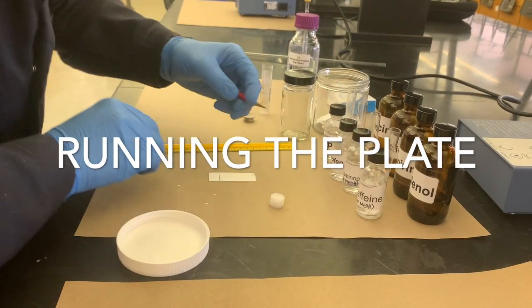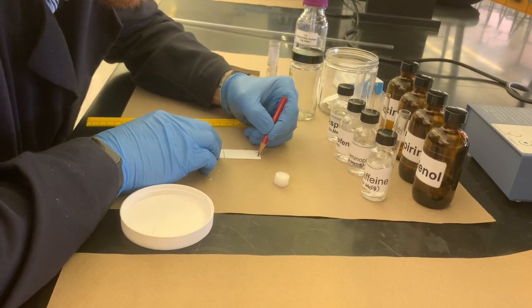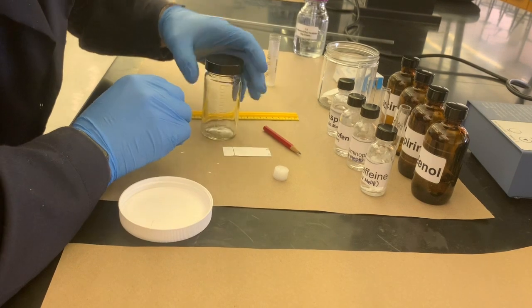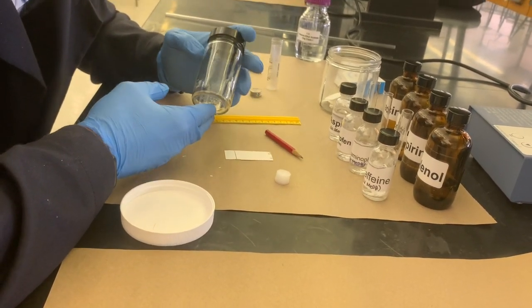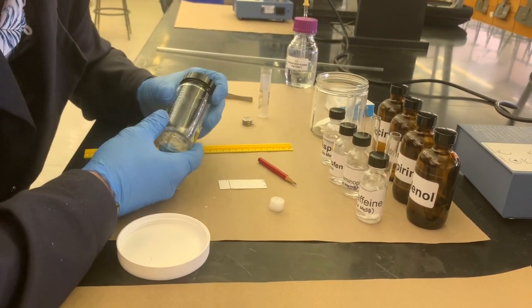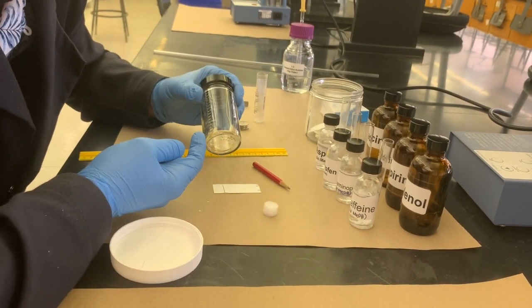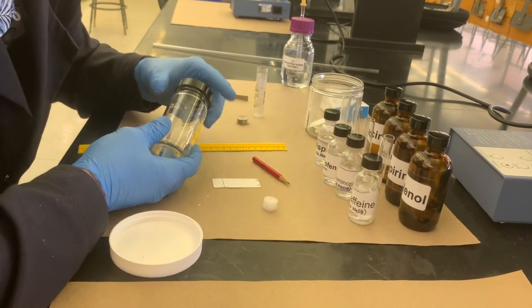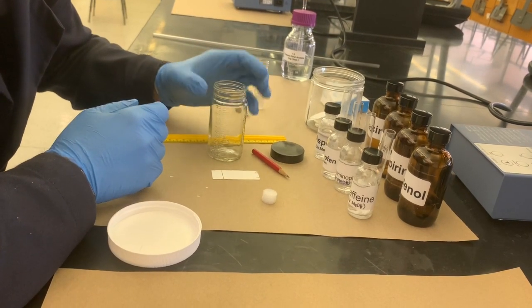So now that you have your TLC plate prepared and labeled, we're going to put a little eye there. We're going to take our TLC chamber and take a look at how it's designed. It's usually good to have a TLC chamber that can be closed. This allows vapor pressure to build up and pushes the eluent along evenly as it goes up the plate. You also want a chamber that's going to be easy to get into if you need to.